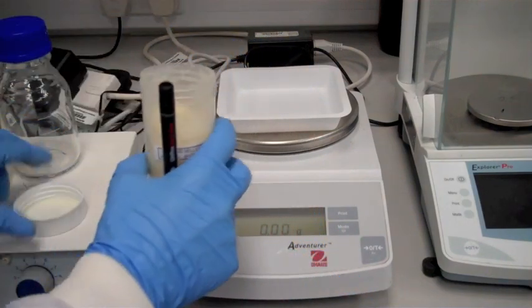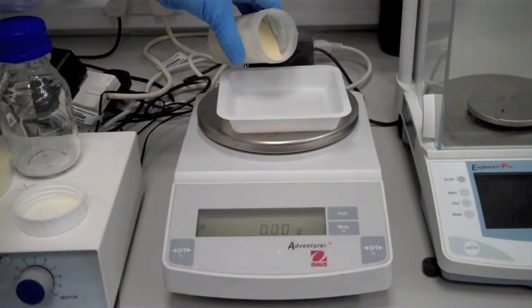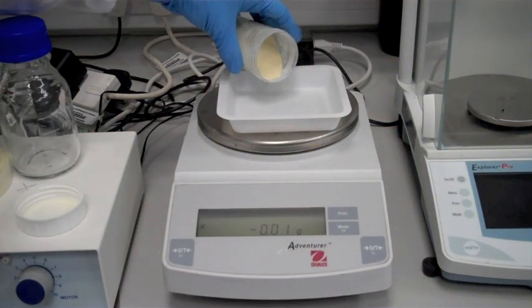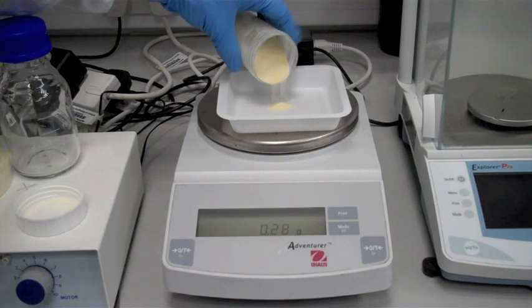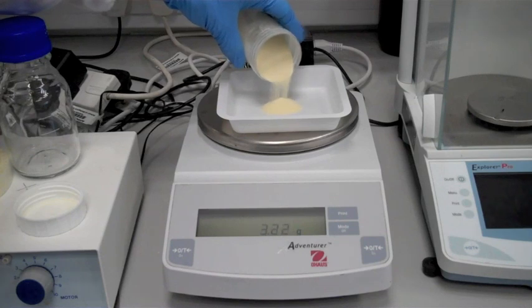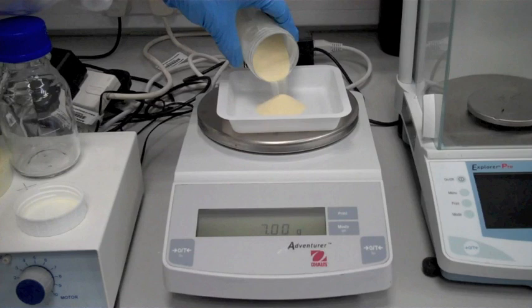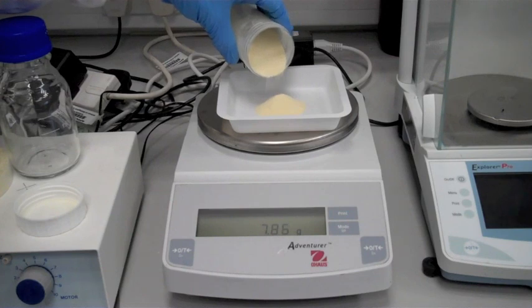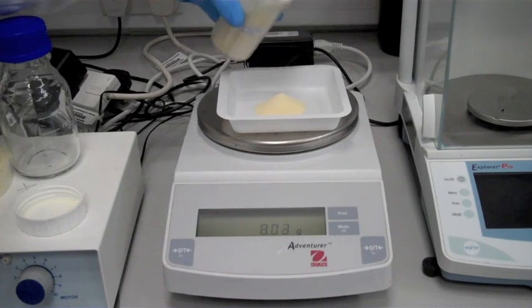So simply take the powder and weigh. Be careful, as this is quite dusty powder. Tap gently, and you'll see the scales going up until you reach eight grams. Slow down a bit. There you go.